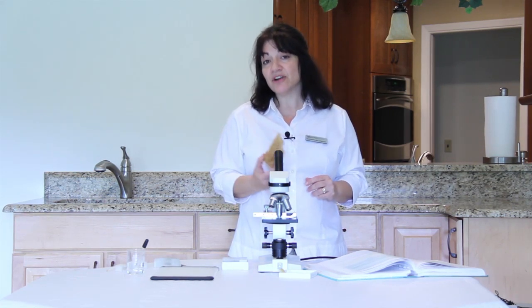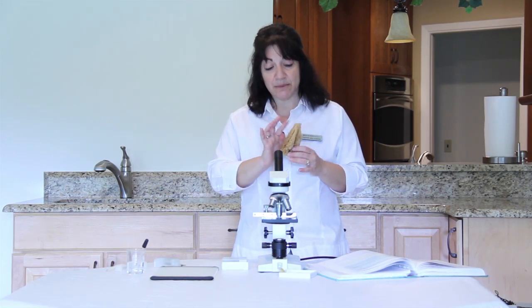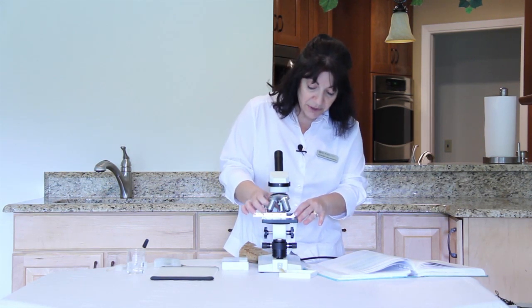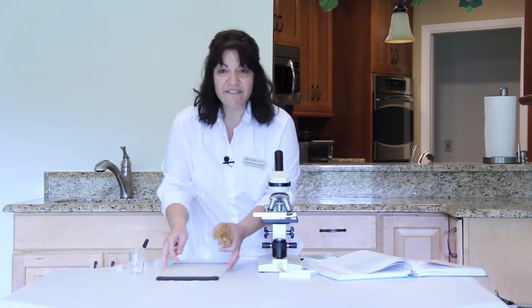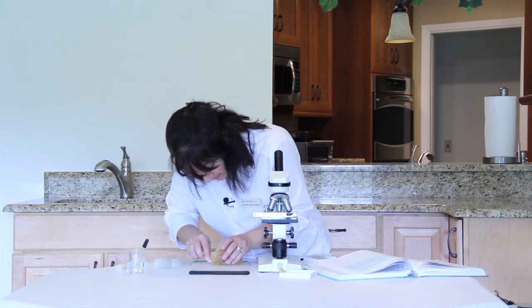And so the second part of this lab, if you have opportunity, would be to take a small sliver of sample from your natural sponge and look at that under the microscope. So we're going to go ahead and do that. I'm going to move my prepared slide out of the way. And you want to take a very, very thin sliver. It may not even look like you're getting very much from your specimen.